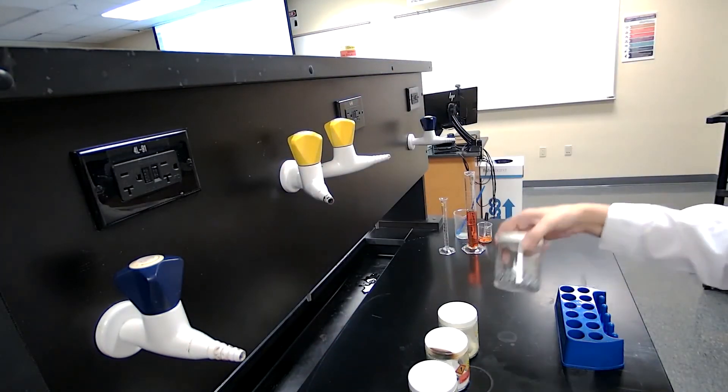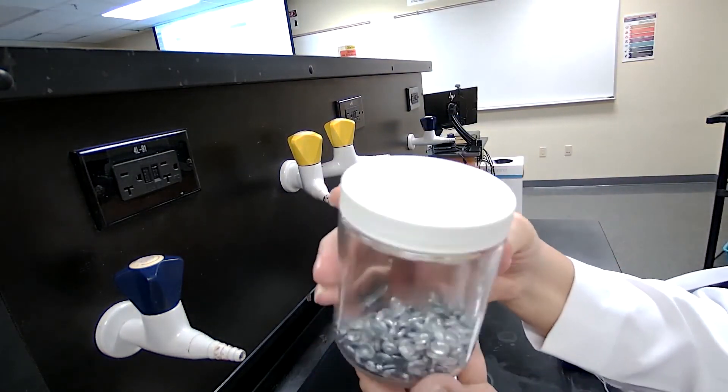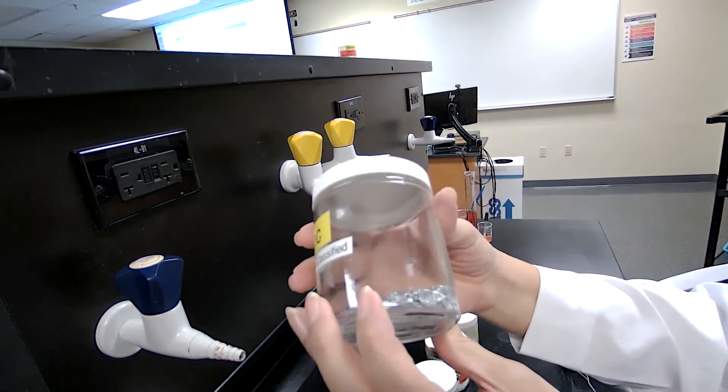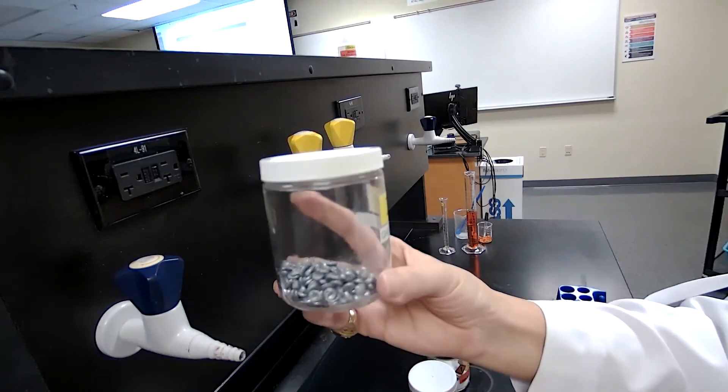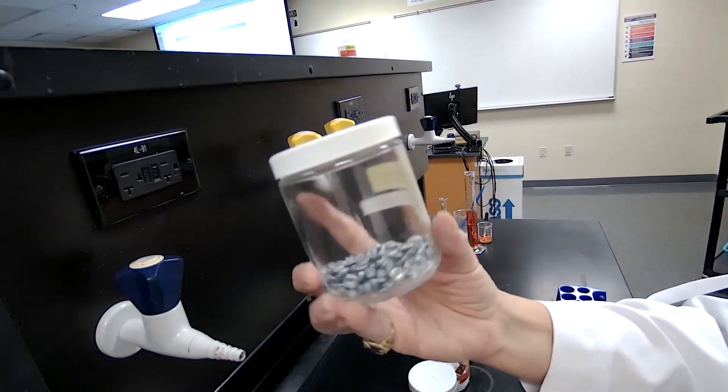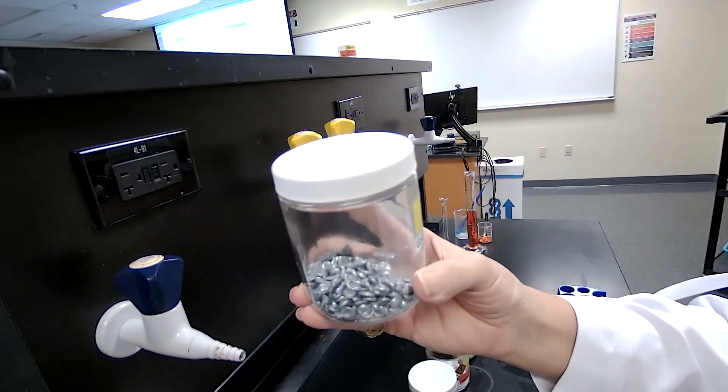Next we have zinc. We have pieces of zinc. We've seen zinc before in experiment one. This is experiment two. We are using zinc for classification of the compound based on metal, non-metal, and also some general properties for the elements.